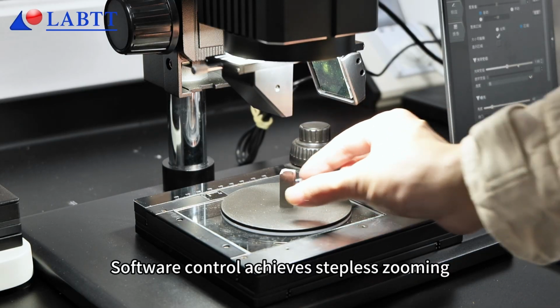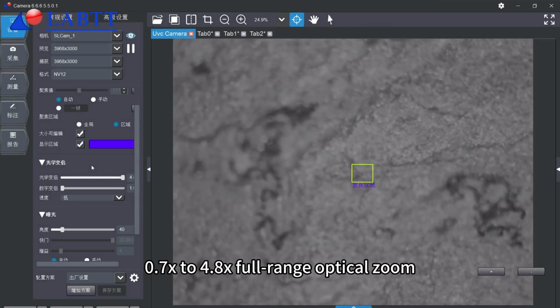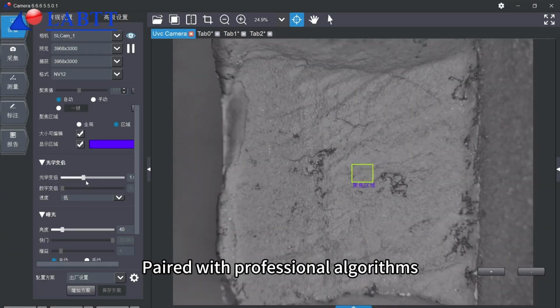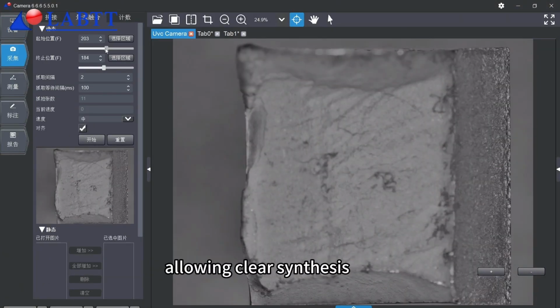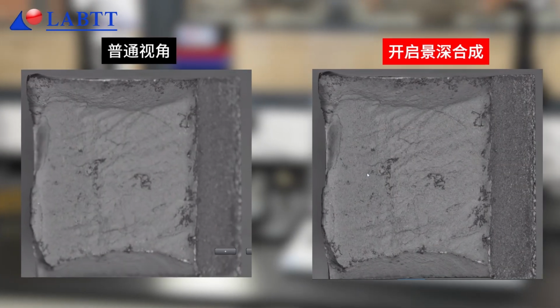Software control achieves stepless zooming. 0.7x to 4.8x full-range optical zoom with a 2-second switching time. Paired with professional algorithms, direct measurement can be conducted after zooming. Depth of field synthesis function, allowing clear synthesis and photography of fractures at different heights.